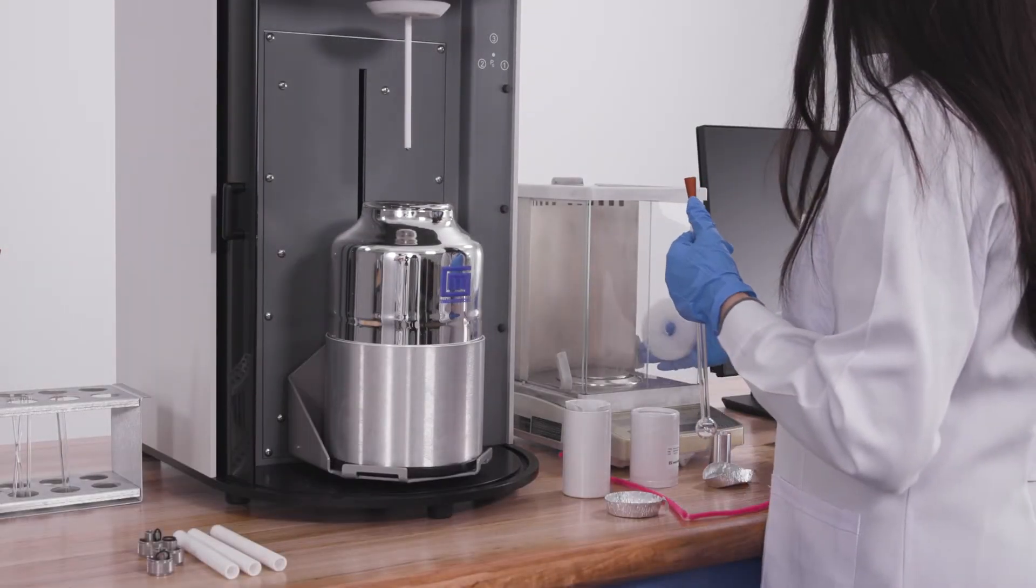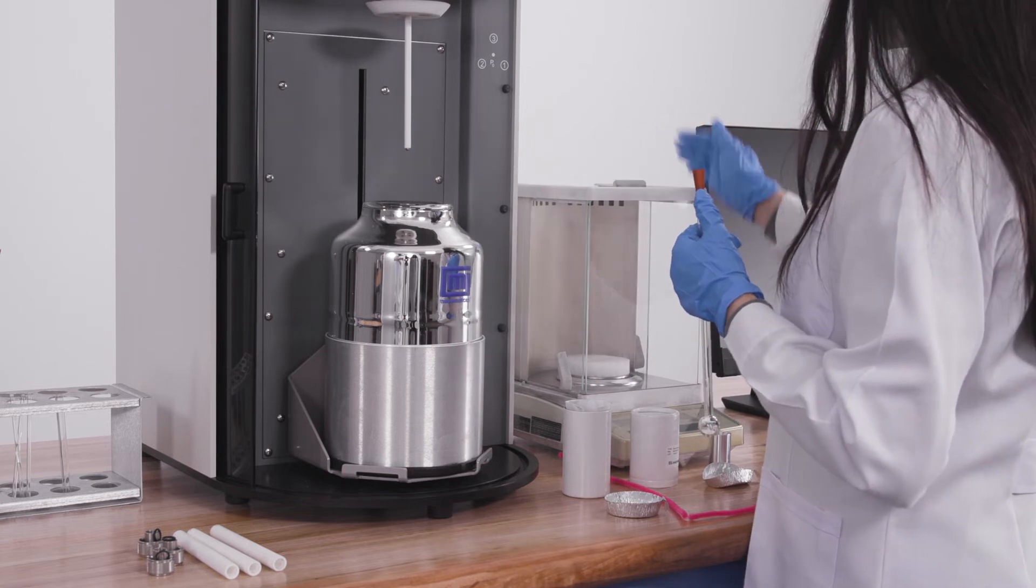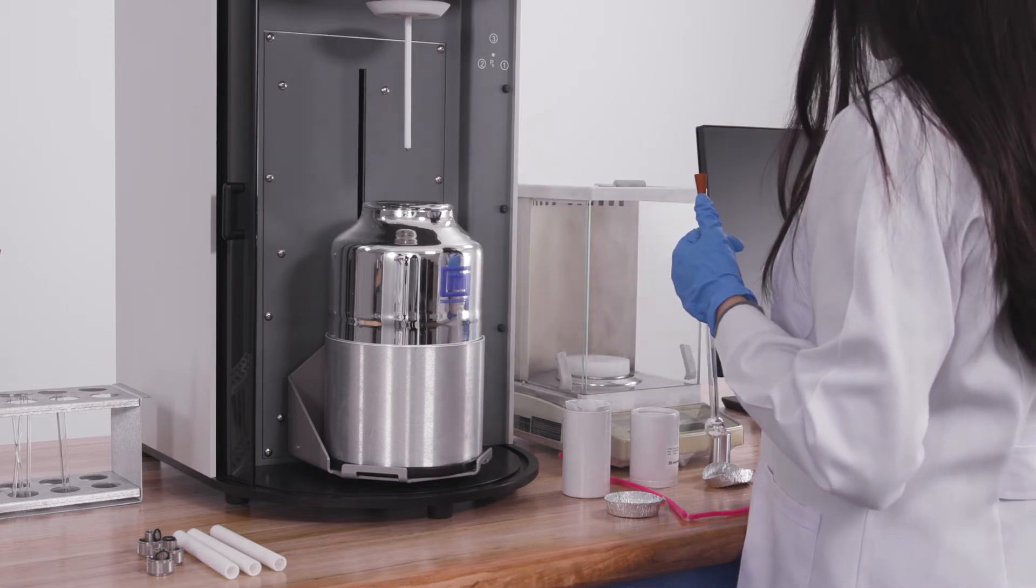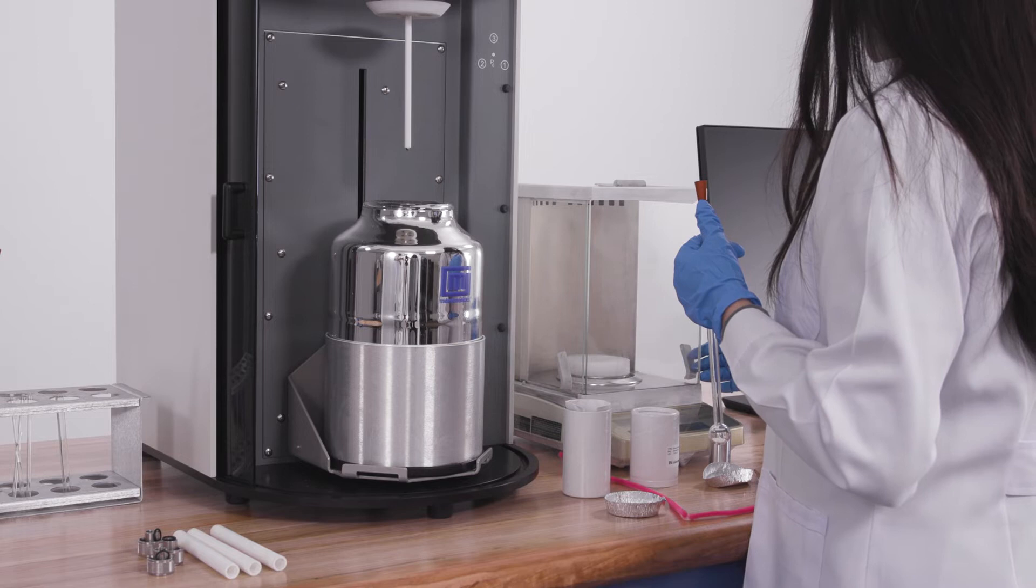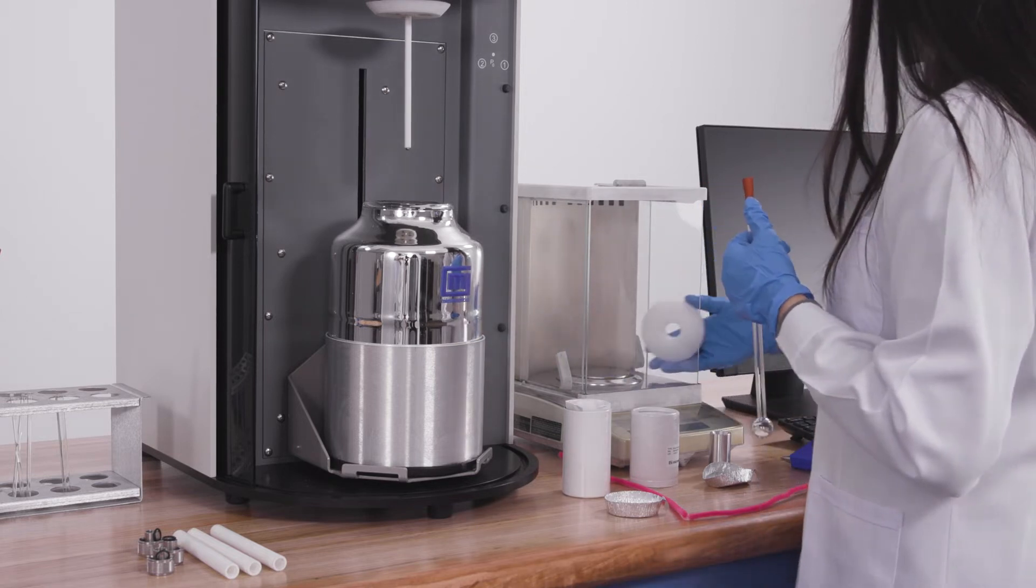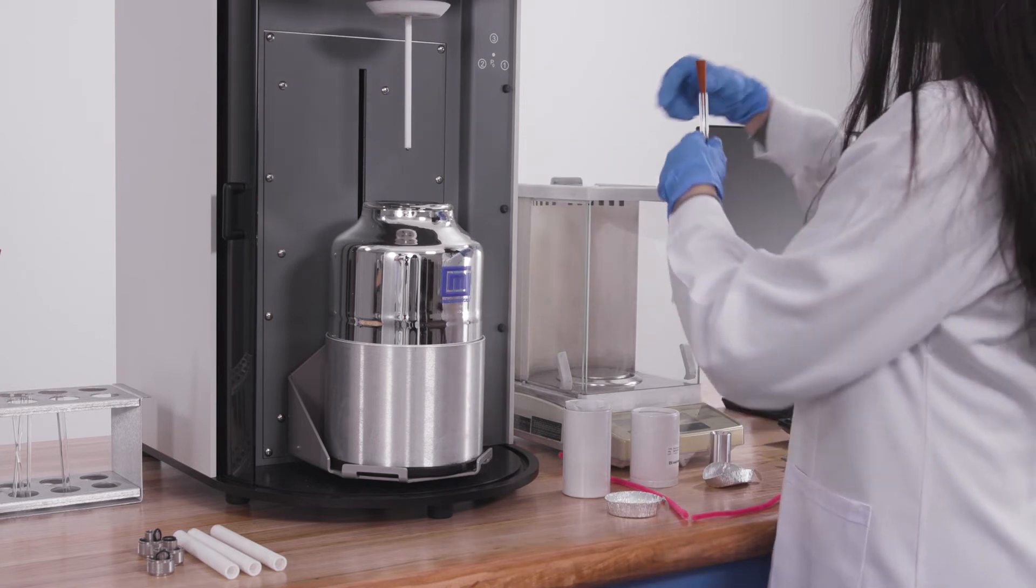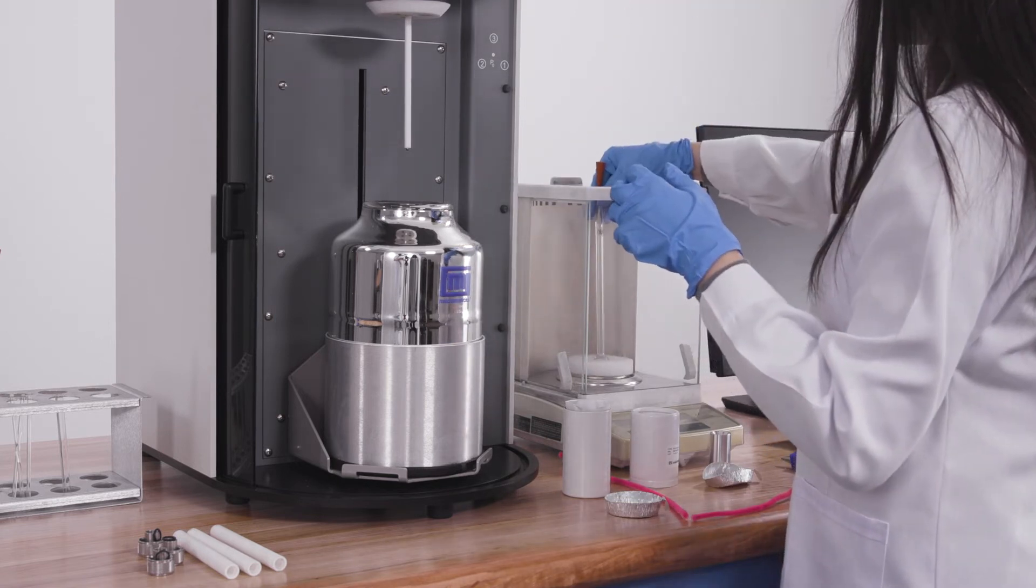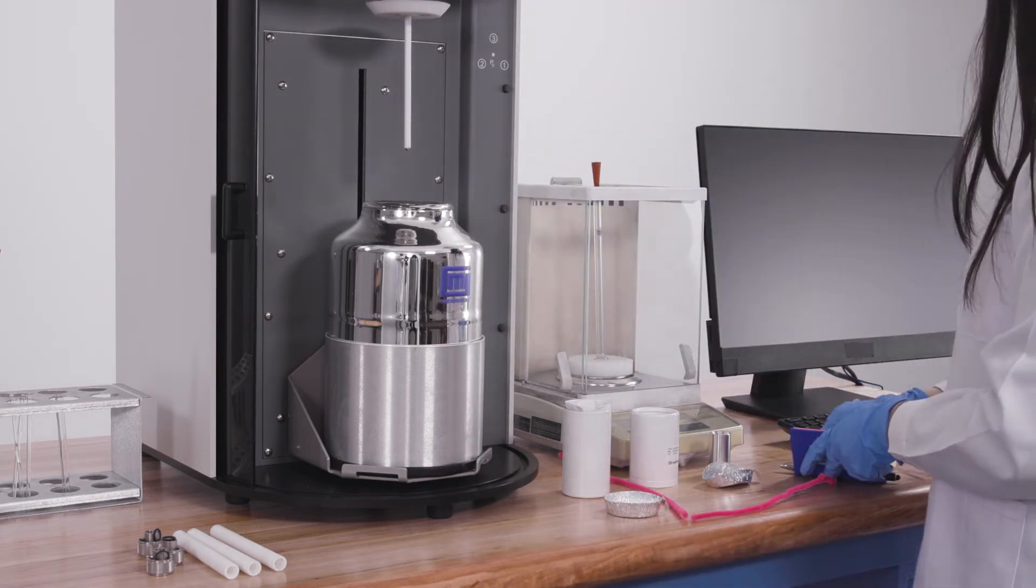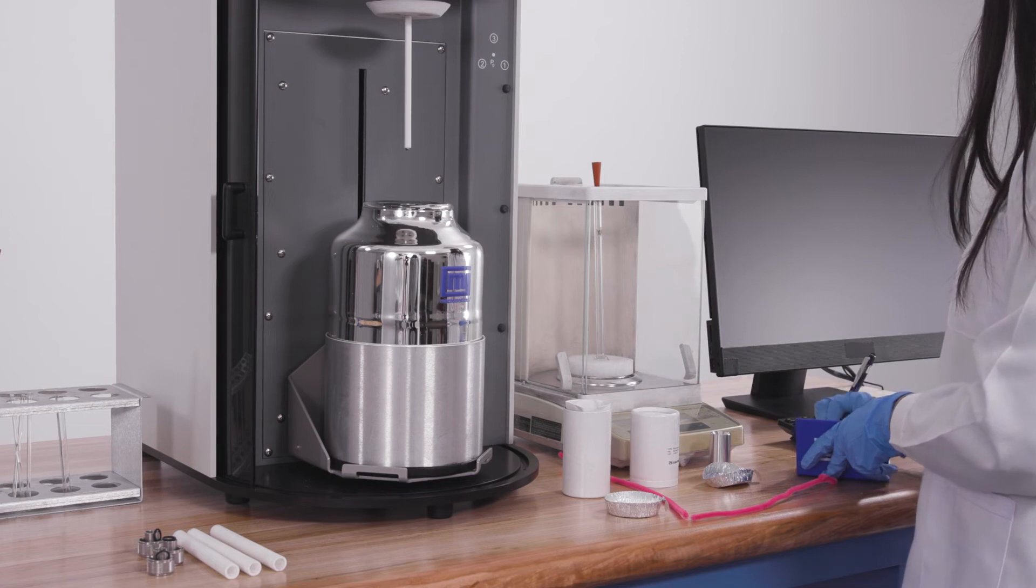Weigh the sample tube after degas is complete. Use the after degas mass for the report.